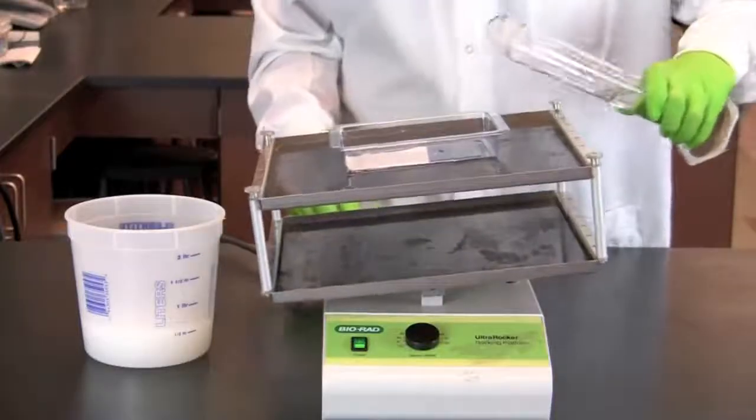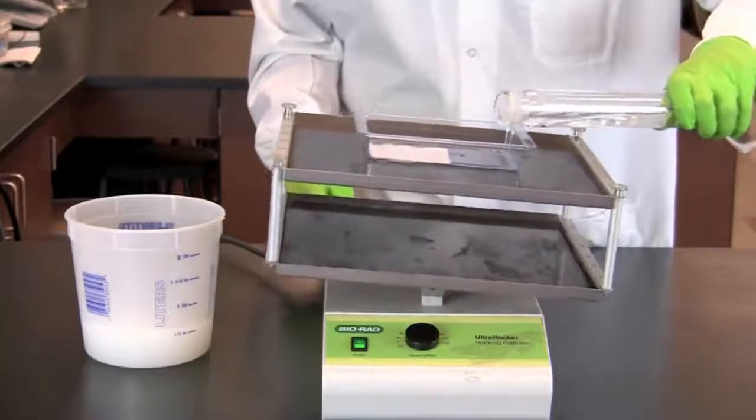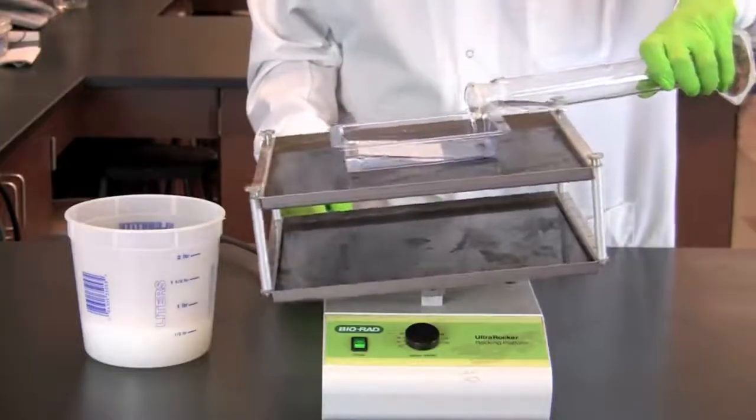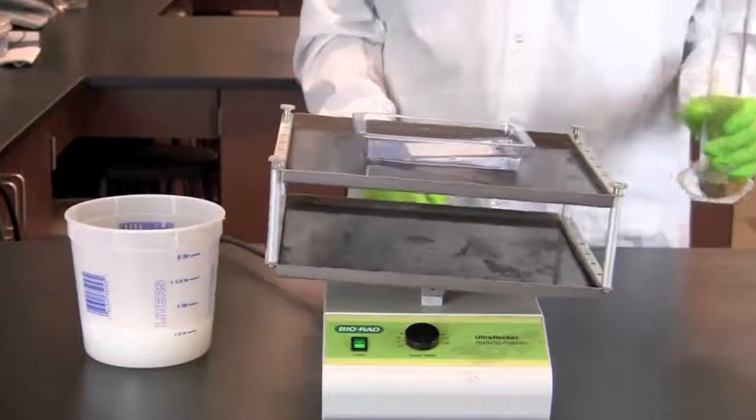Incubate the membrane with the substrate for 10 to 30 minutes with either manual shaking or on a rocking platform. Watch for the color development.